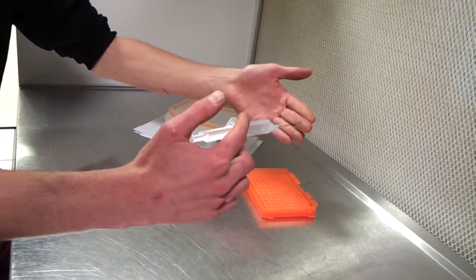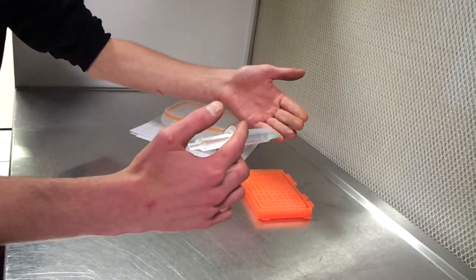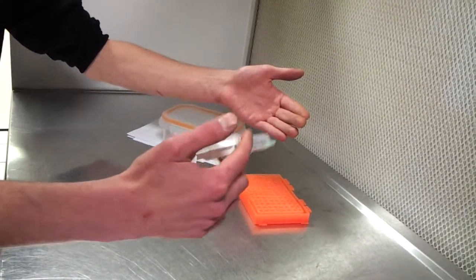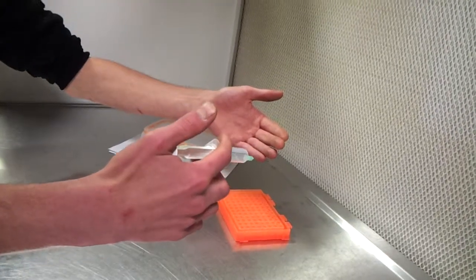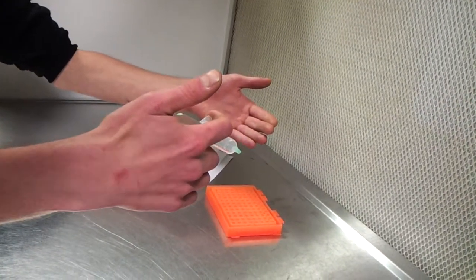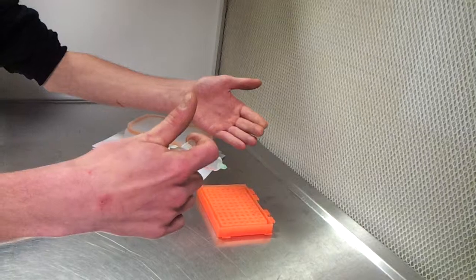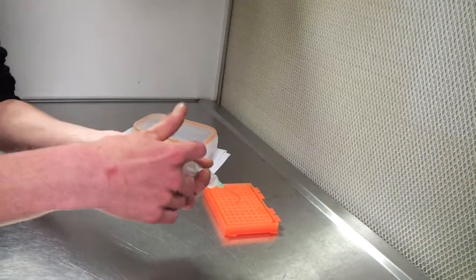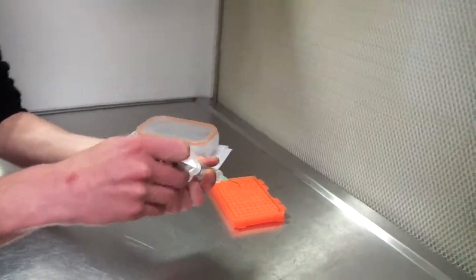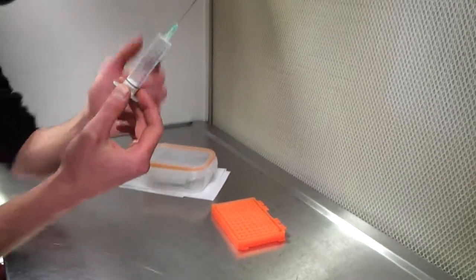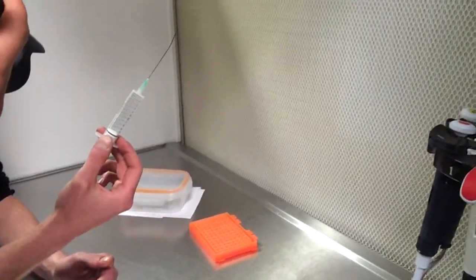So you do like this, spores fall down the glass, and after that, you put a little bit of water in it to mix it. You take it back, and you have the spores in your sterilized water. Great.